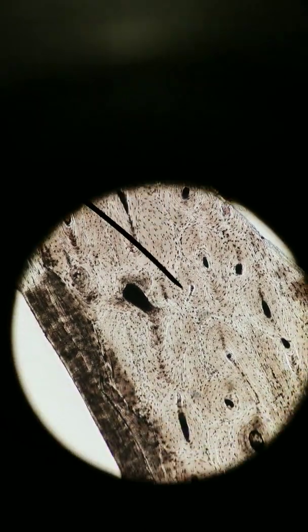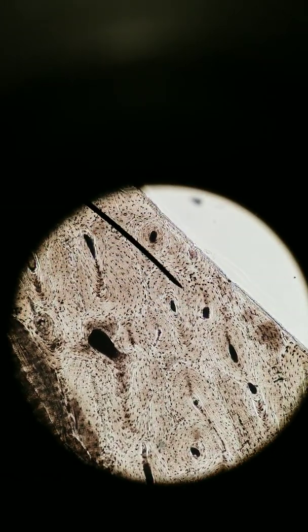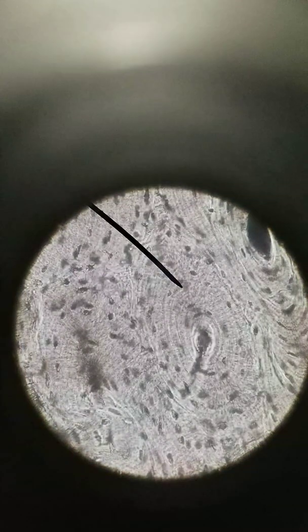Let's take a closer look at the extracellular matrix within one osteon. Let's choose this one. Going to 400x total. All right, here again is the central canal. Let me go to a darker one. Here again is the central canal, and you can see the lamellae extending out. So there's lots of lamellae, lots of layers of concentric circles, and lots of osteons that border each other.